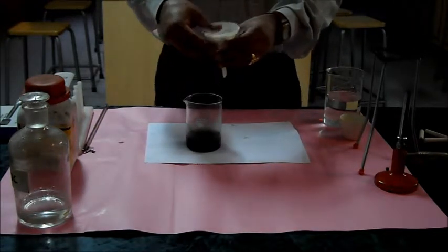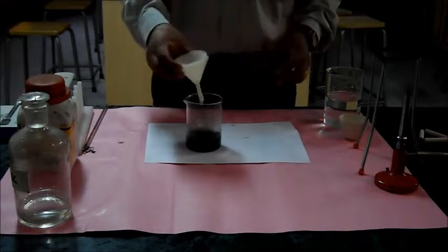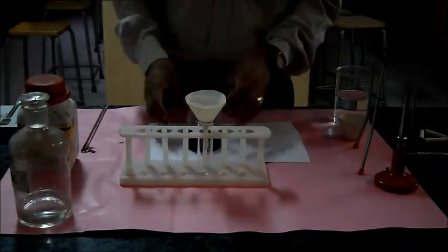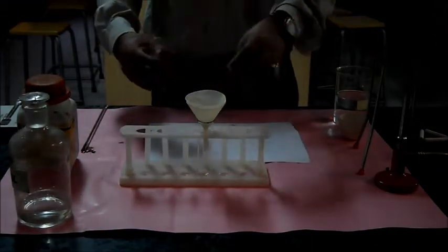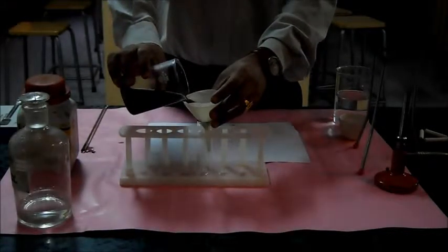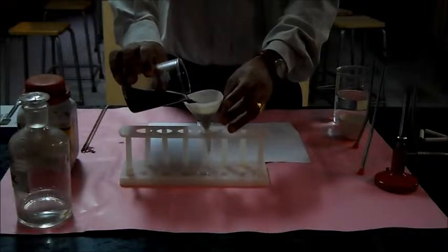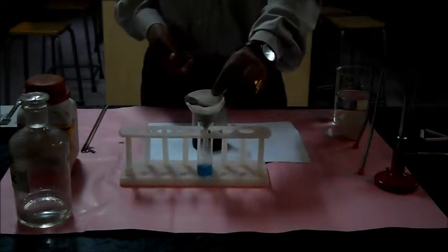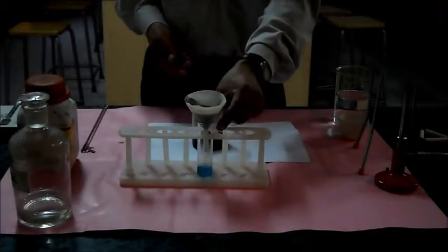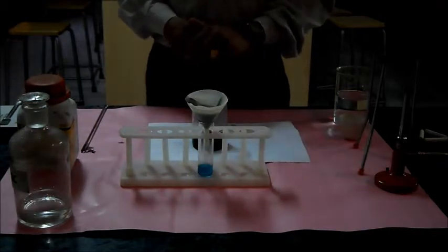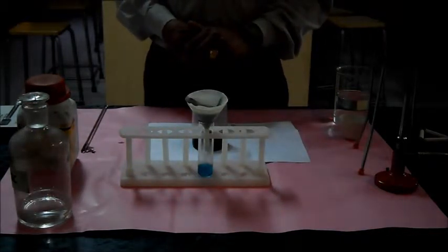And now I can filter it. For filtering, I will filter this solution in the tube here. The color of the solution is blue, and this blue color solution contains copper sulfate.